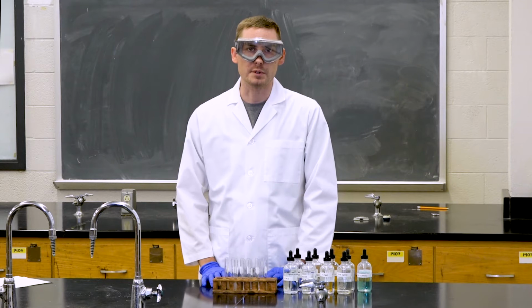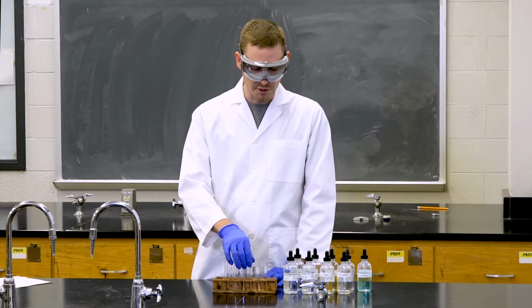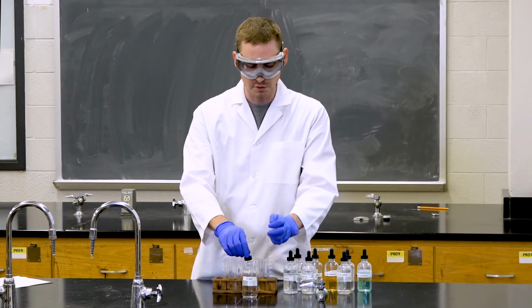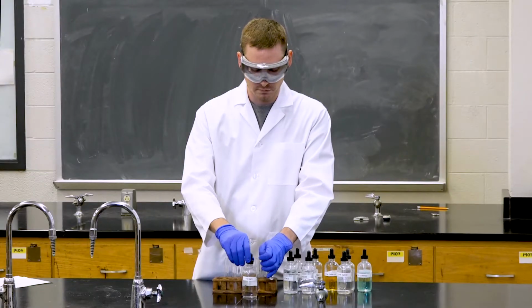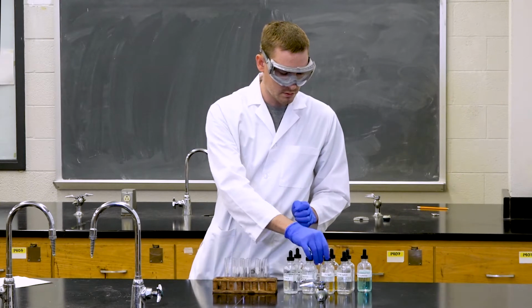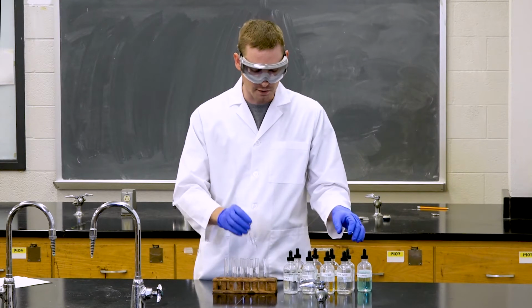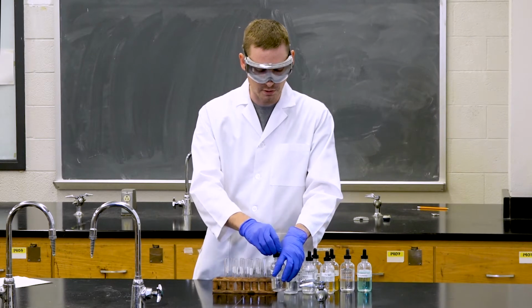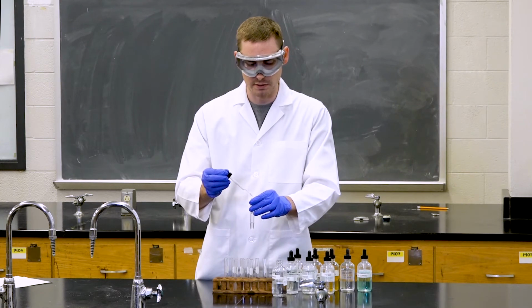For the second part of the precipitation test, we're going to be doing a test with sodium chloride and silver nitrate. First, we will add 10 drops of sodium chloride, which is basically salt water, to a test tube. In our other test tube, we have, once again, a milliliter of distilled water. We can then add silver nitrate to both test tubes and observe the change that happens. So first we'll add it to distilled water to see our negative test.